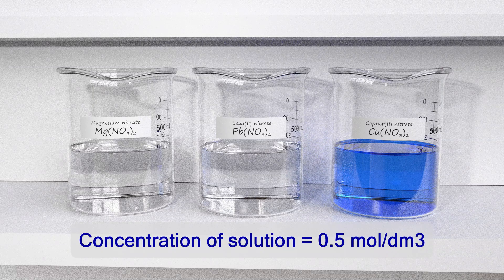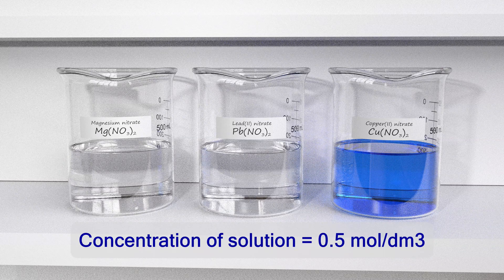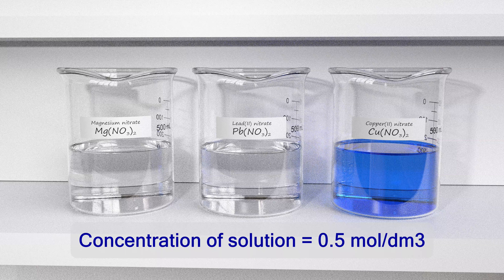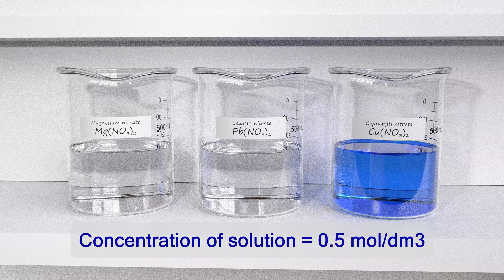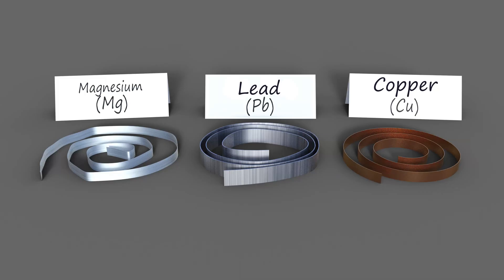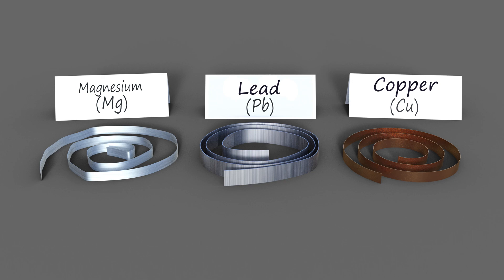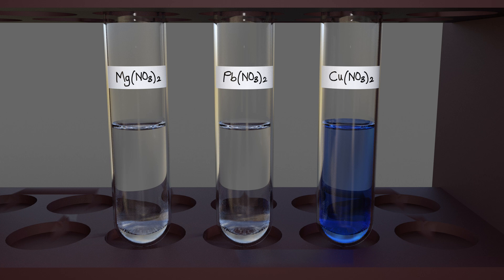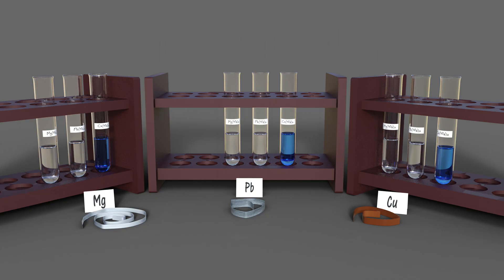The solutions required in this experiment are magnesium nitrate solution, lead two nitrate solution, and copper two nitrate solution. The metals needed are magnesium ribbons, lead strips, and copper strips. Ten cubic centimeters of each of the three solutions are put into three separate test tubes, and three identical sets are prepared.